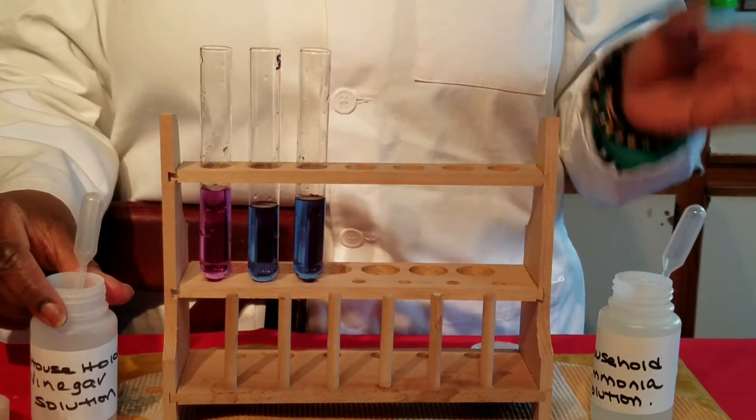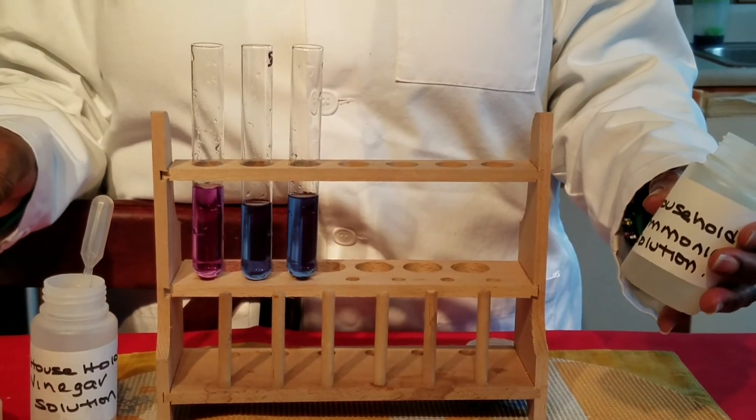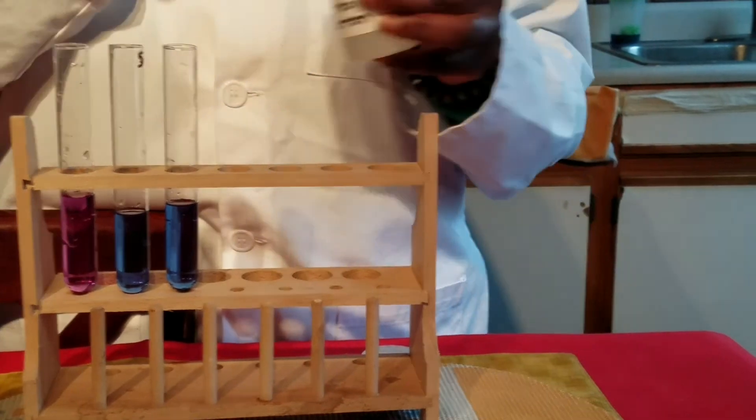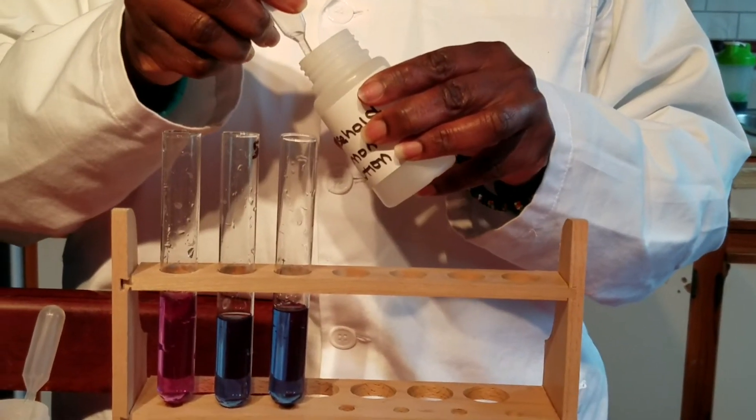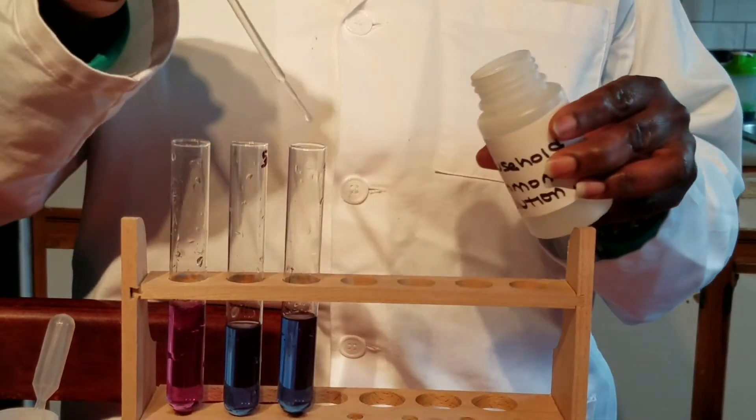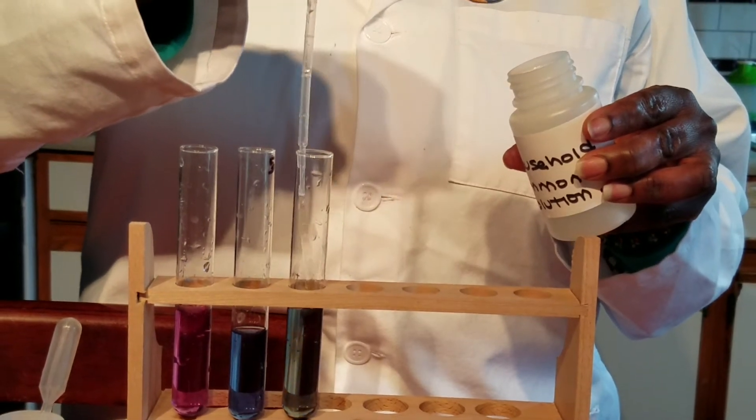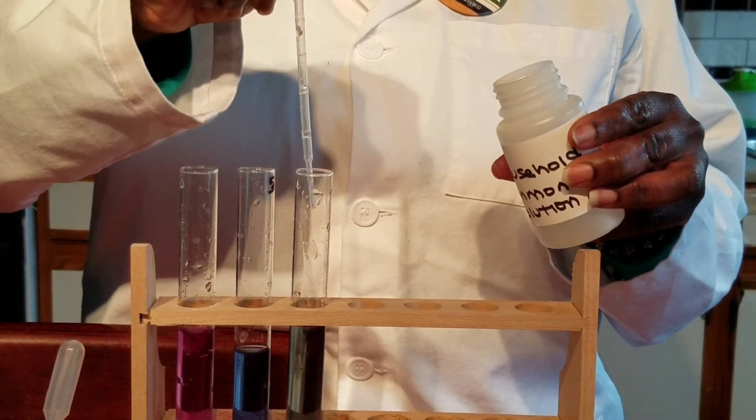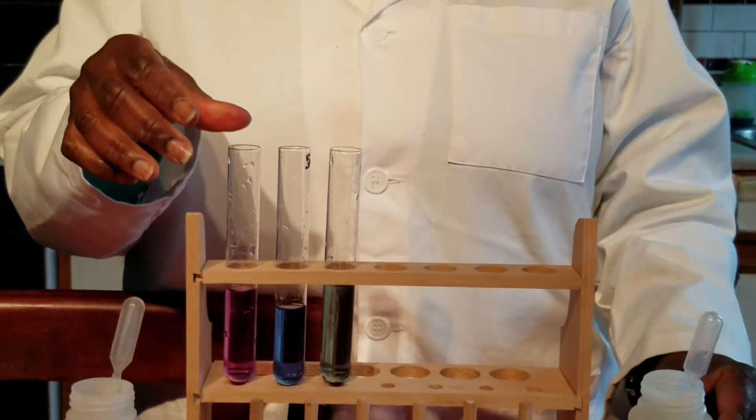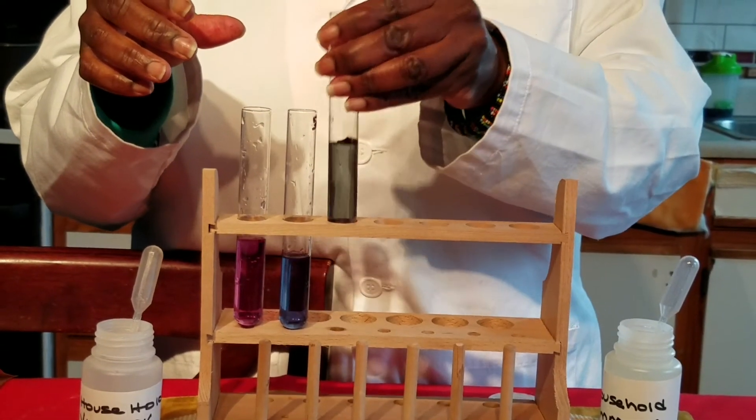And to the test tube on your right, I am going to add some common household base which is ammonia.